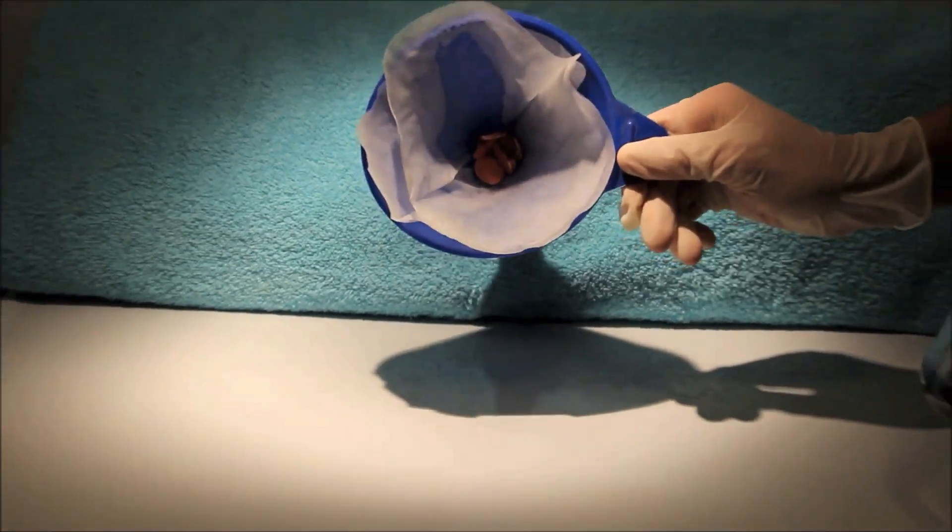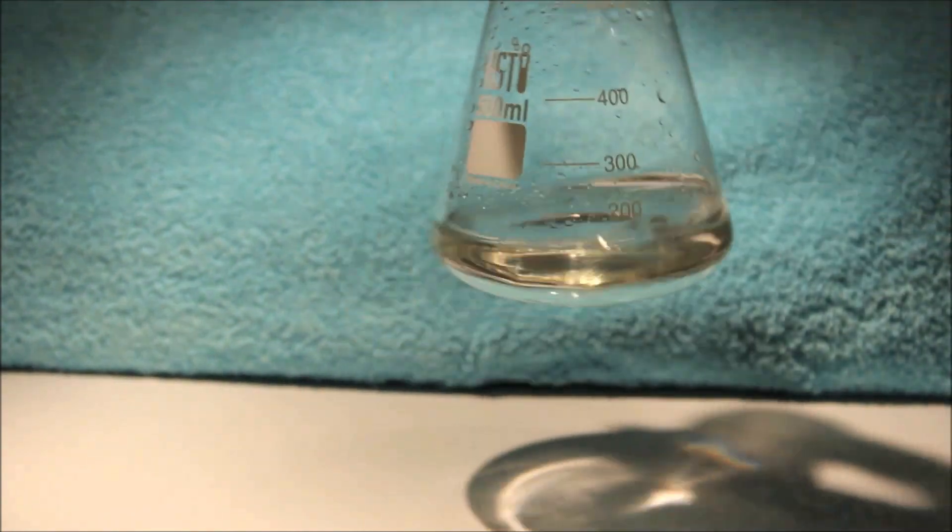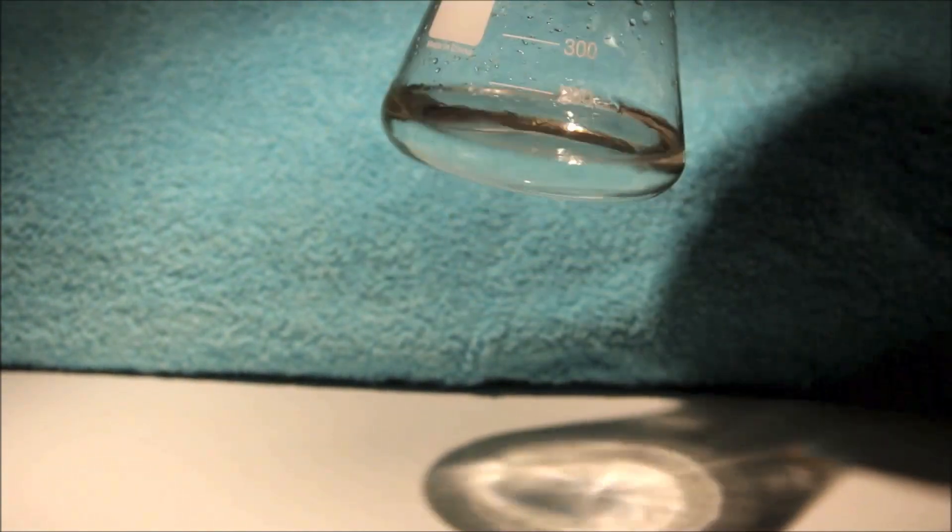Here are the pennies after filtering, here let me zoom in on that. This is the solution of zinc chloride. Save it if you are going to perform the experiment in the second part of this video.